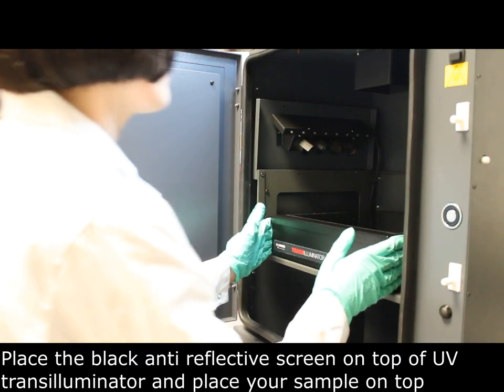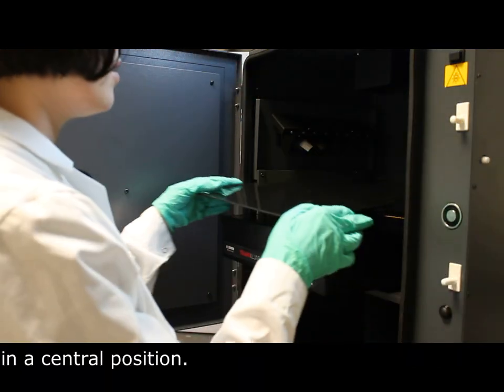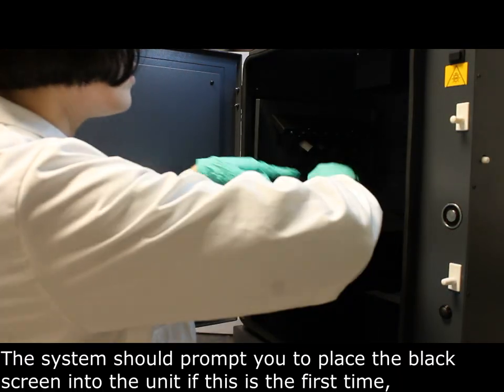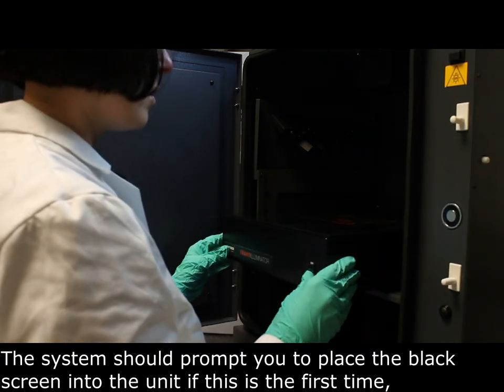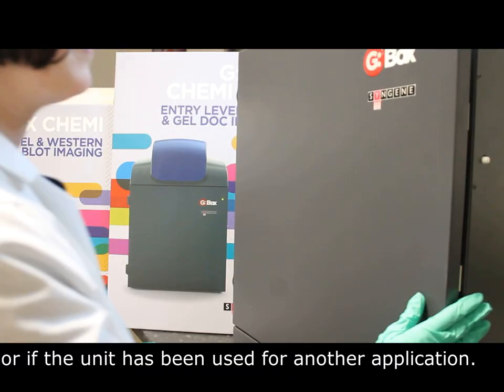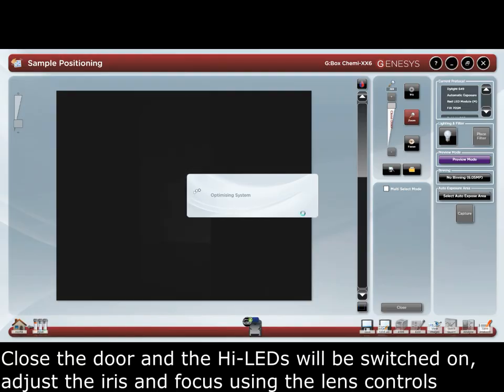Place the black anti-reflective screen on top of the UV transilluminator and place your sample on top in a central position. The system should prompt you to place the black screen into the unit if this is the first time or if the unit has been used for another application. Close the door and the LEDs will be switched on.